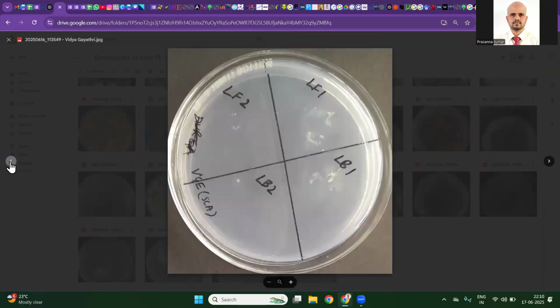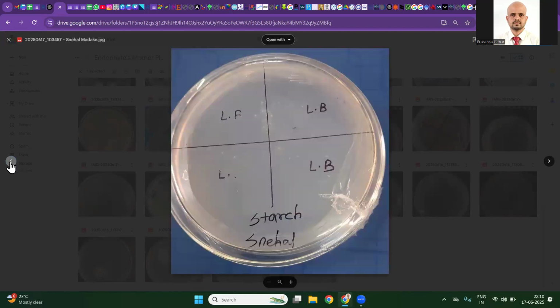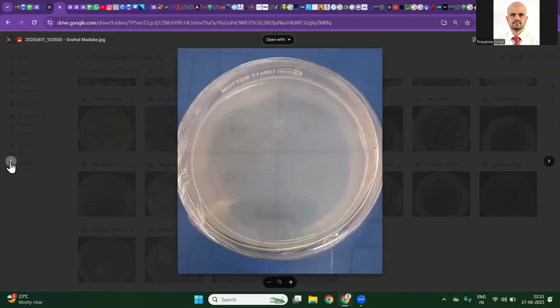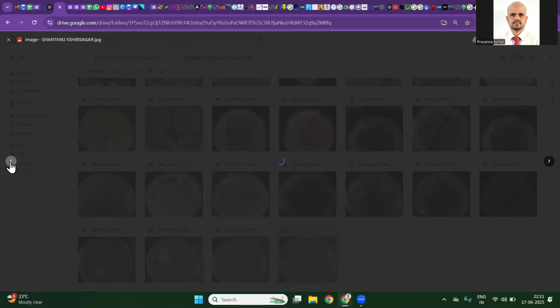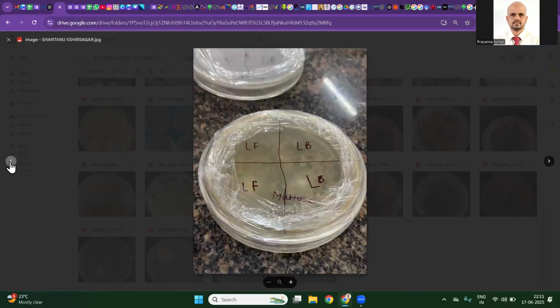Here also the same. By now we can see the nature of this. This is a relatively clean plate, front and back pictures, good. Imprint has growth. By now we can see where the mistake is. If tomorrow you observe the same imprints, you should know how you have introduced them. Always use a black background. This will not tell us anything if you are not using an appropriate background. Again, the imprint has growth.